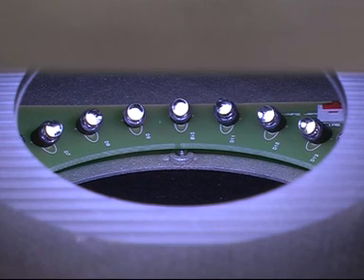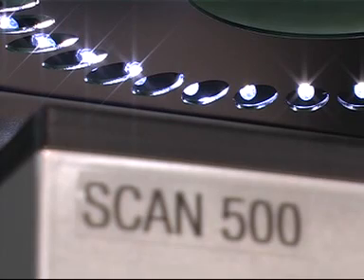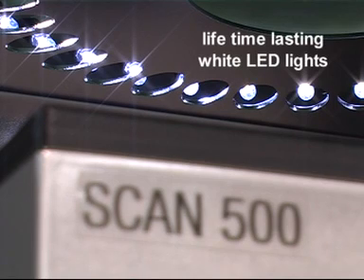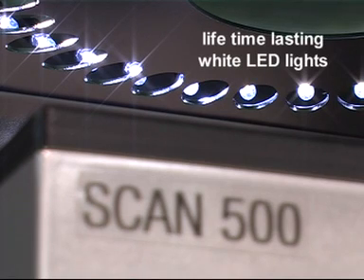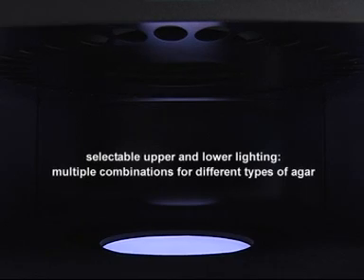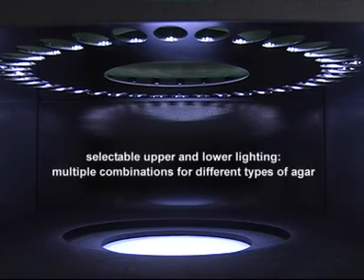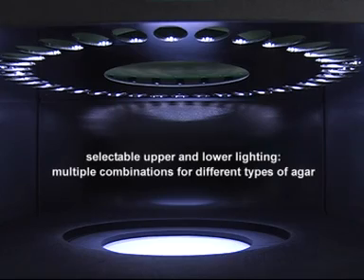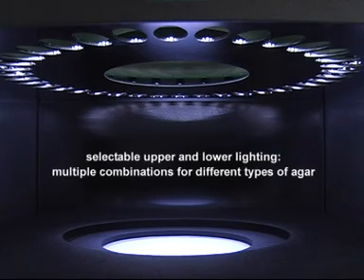Lighting is made by lifetime lasting white LED lights. Scan500 allows multiple lighting combinations, depending on the type of colonies you need to count.